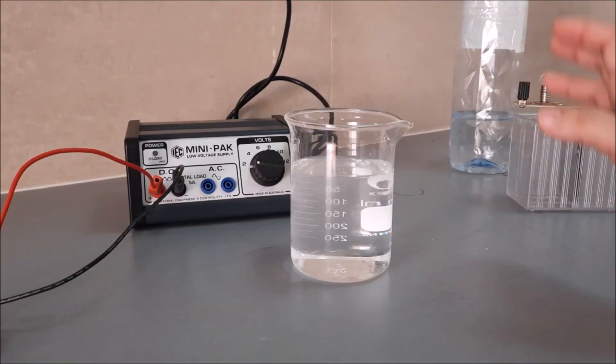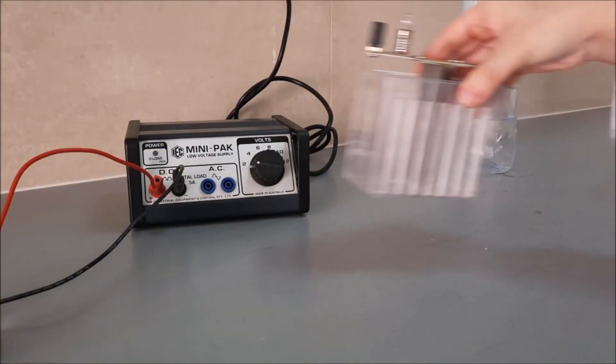We have to mix it properly. So after mixing, let's put this first aside, and let's check our container.